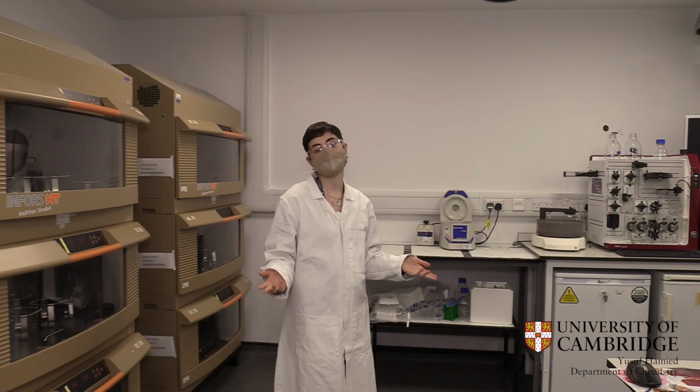Okay, so here we are in the basement of the Chemistry of Health building, where we have dedicated facilities specifically for producing protein. So obviously that's really important because we study protein, so we make all of our protein down here. And as you can see, we have a lot of equipment which is specifically tailored for this, which enables us to actually do our research and produce as much protein as we need to be able to do all of our experiments.